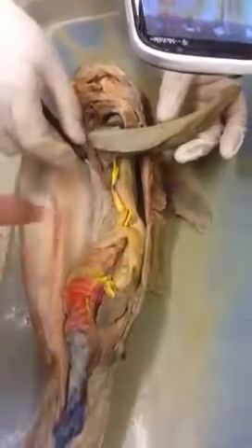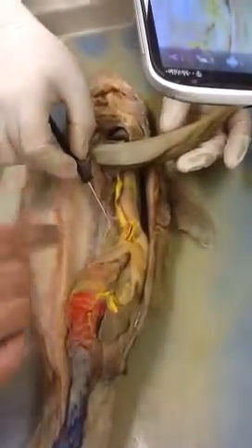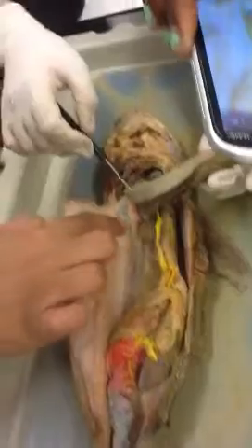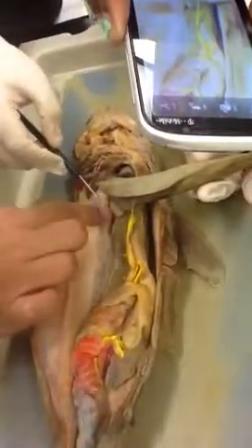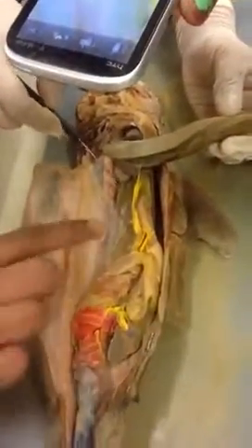So going down the dorsal aorta, if you pick up the liver, that pink thing right there, that's your celiac artery, the first one. And then its first branch is actually your genital artery, which is the little branch that reaches to your testes. This one. Yeah, that's your testes, so it goes into your testes. Right here.